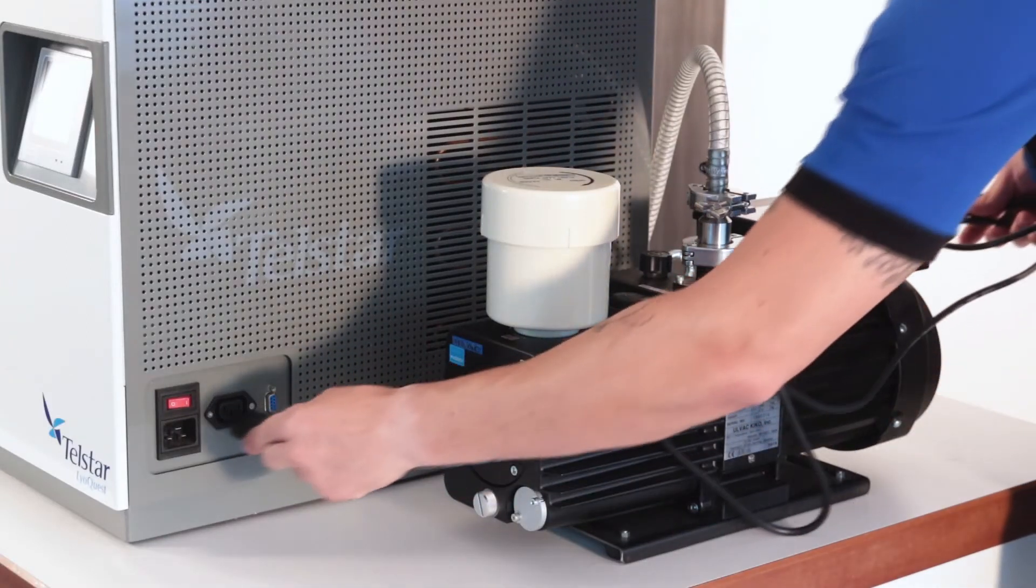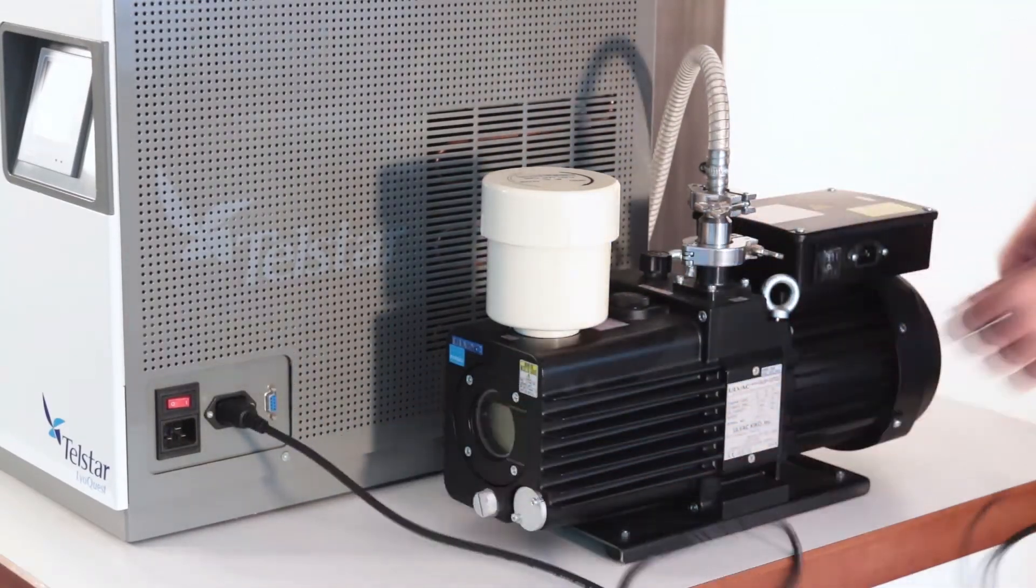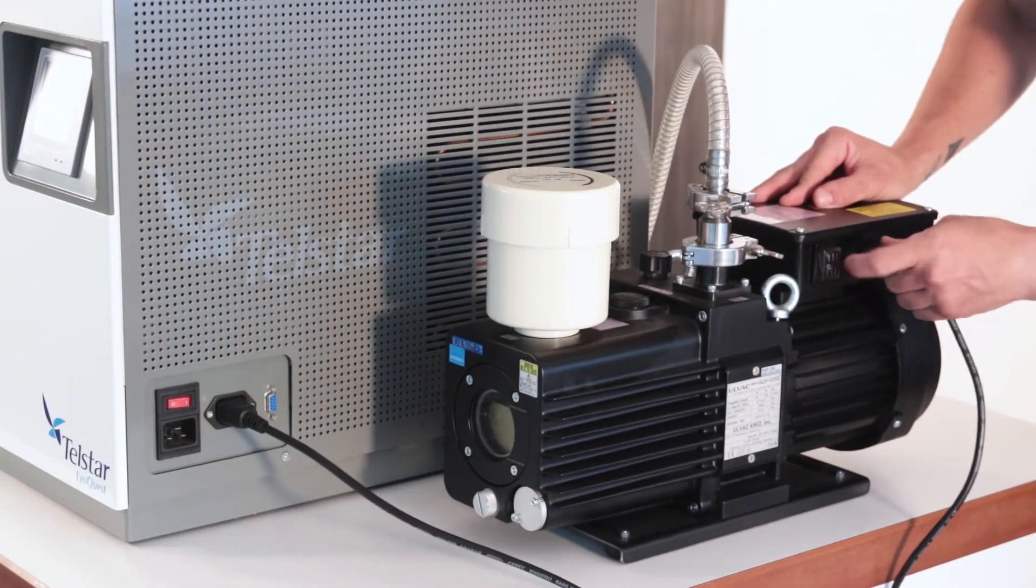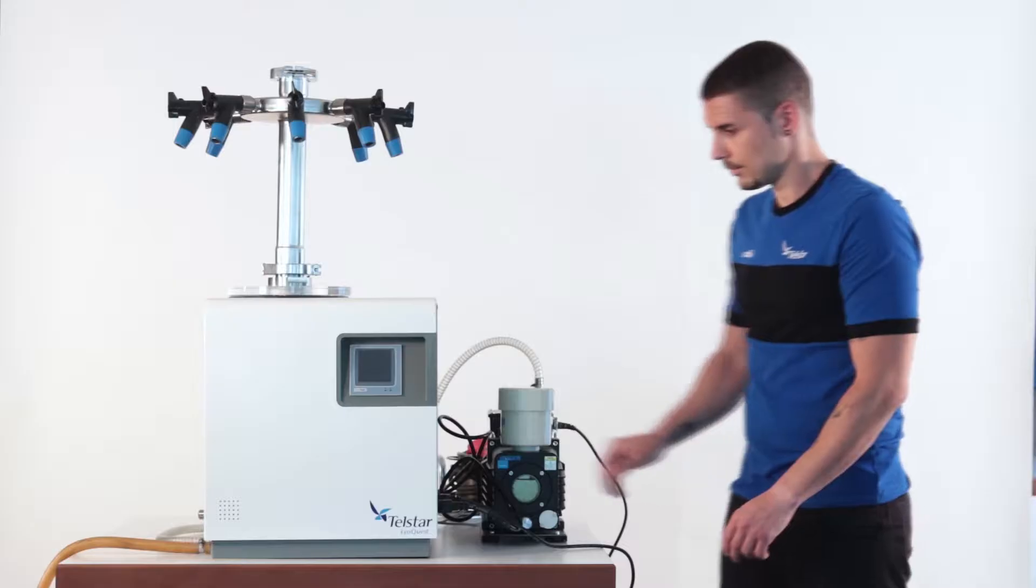Connect the cable of the vacuum pump to the basic unit.